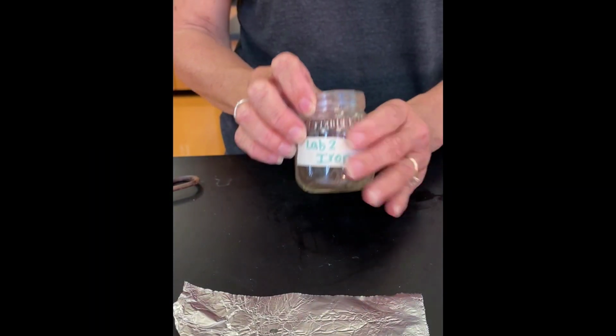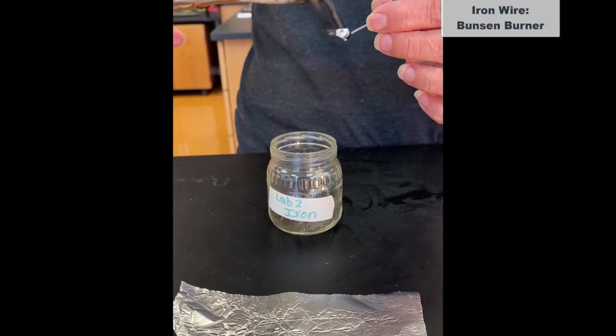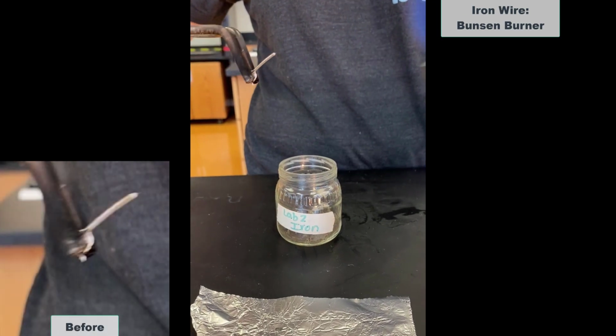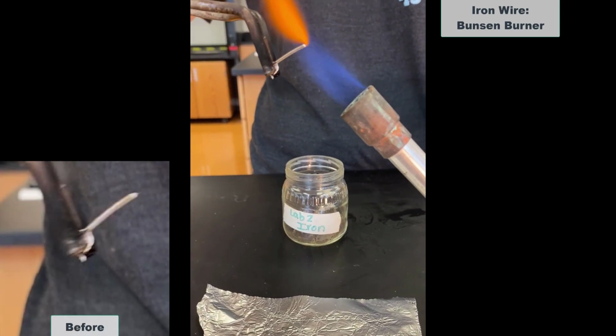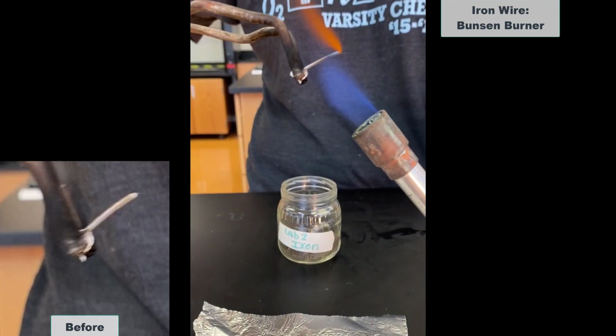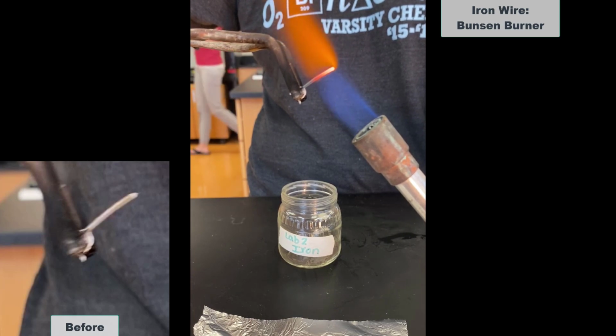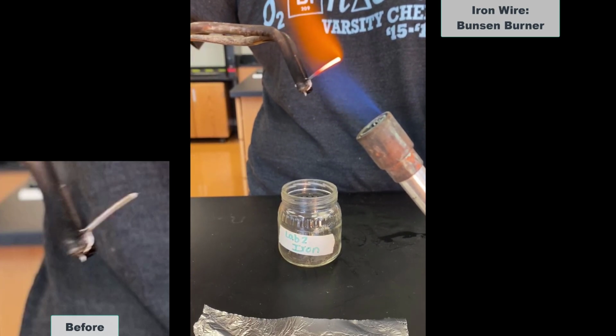And now for iron. That was my iron before. And there we go. See it getting red hot again.